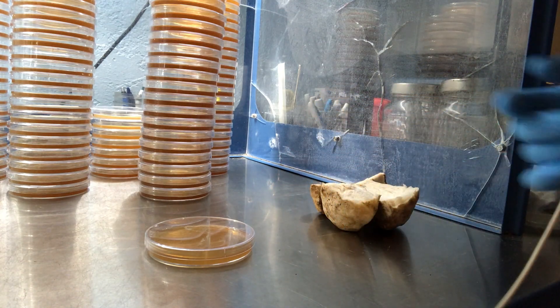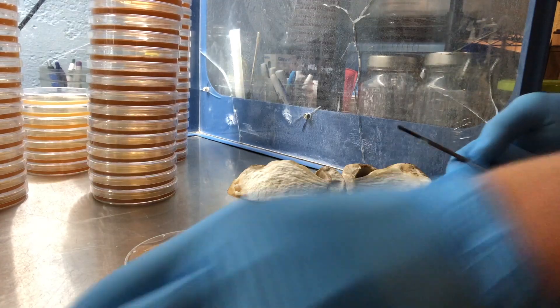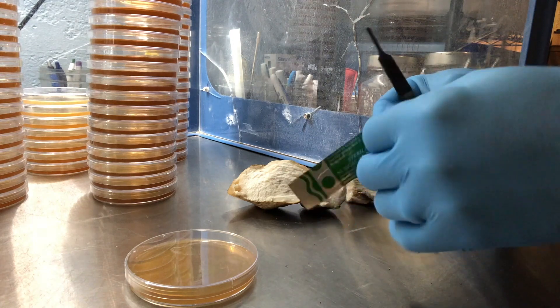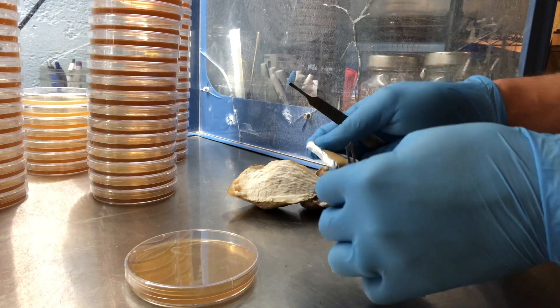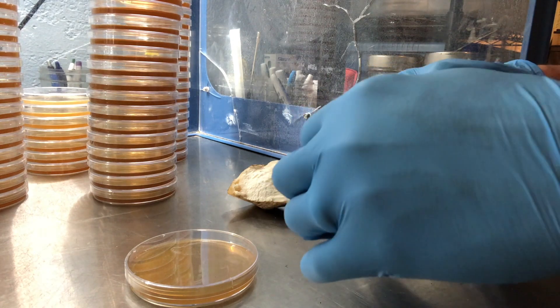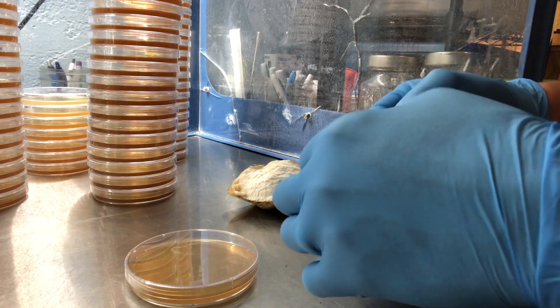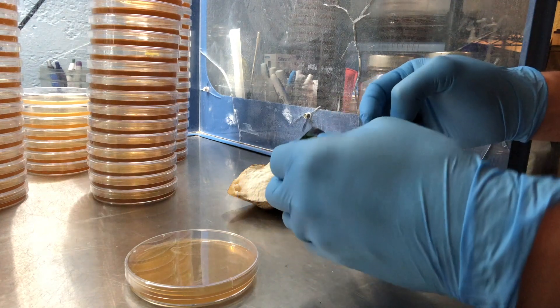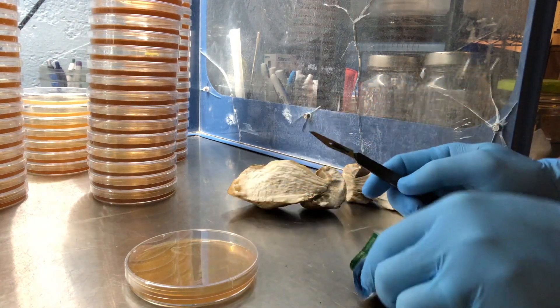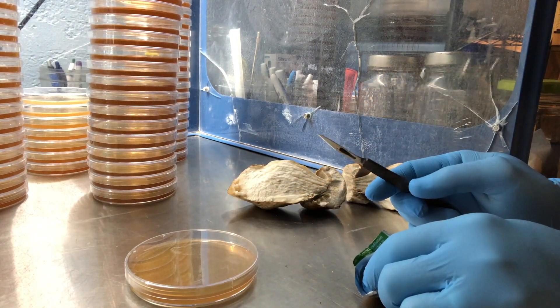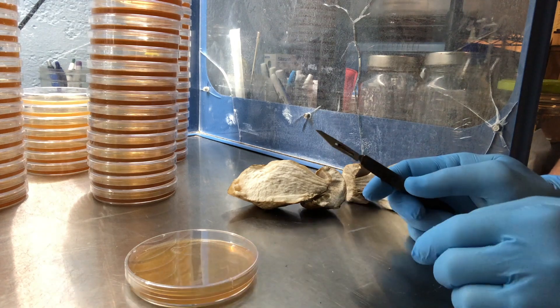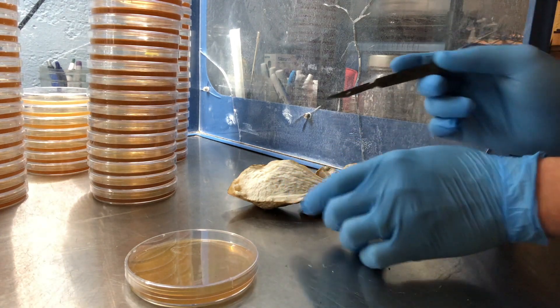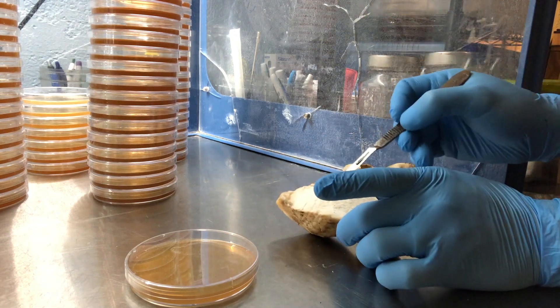Okay, so I've got a fresh blade here, number 11. I really like using the number 11 to clone because they have a really nice point on them, which you'll see in a second here. You can see how nice and precise that cut's gonna be. So I'm gonna choose this region here.